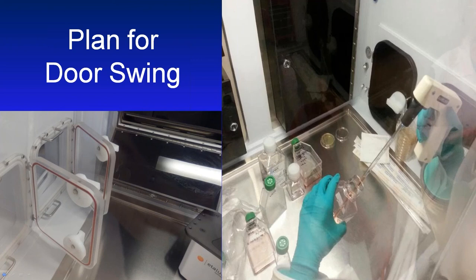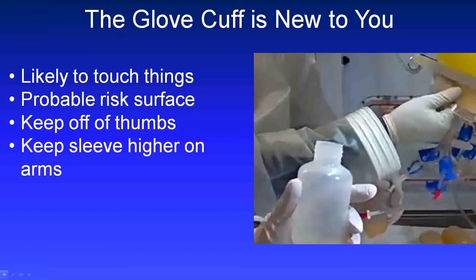And you might consider using a small tray to contain a lot of small items if you're going to anticipate that you're going to need to move them in order to do something like open up a door. So that's just one tip that might help you avoid frustration from having to move things around frequently during your process.